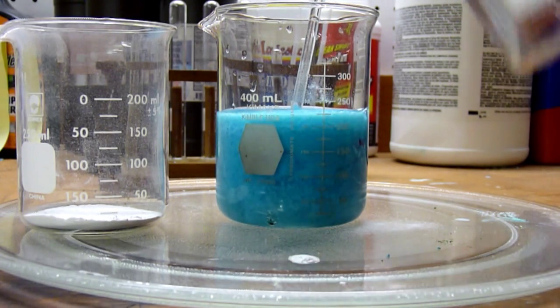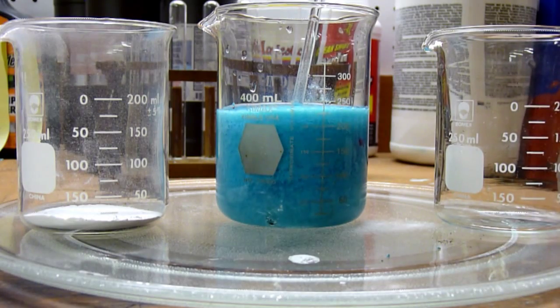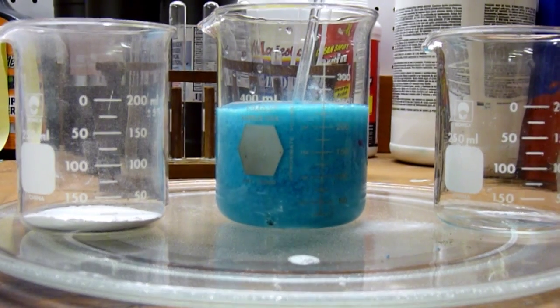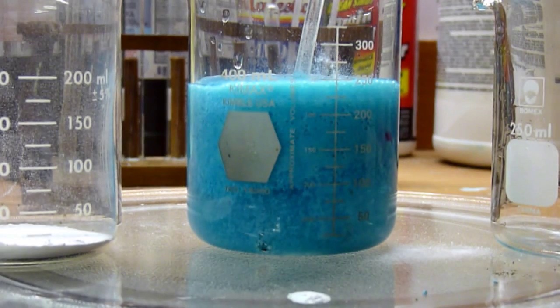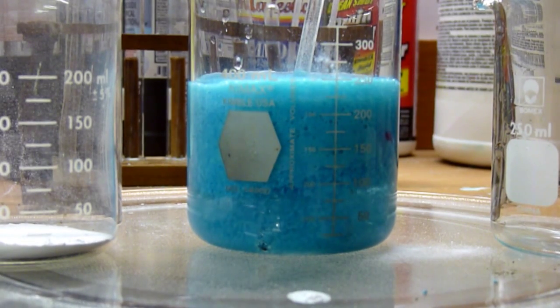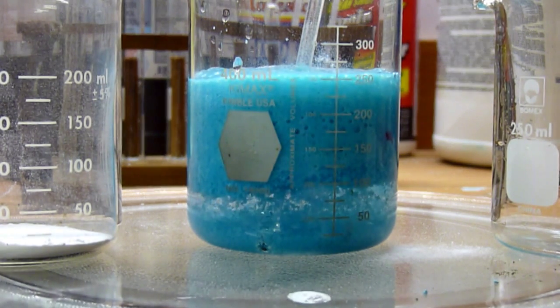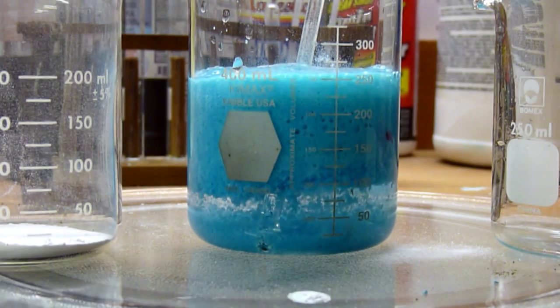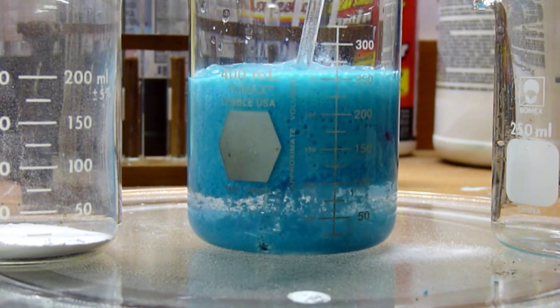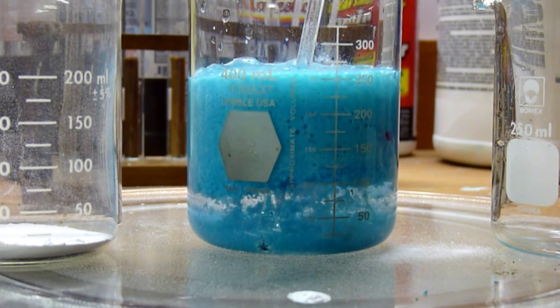There we go. Now, as you can see, it wasn't fully decomposed, so we do have a slight amount of foaming. However, not nearly as much as before. And that is our copper 2 carbonate. You can see it falling right out of the solution, and collecting on the bottom.